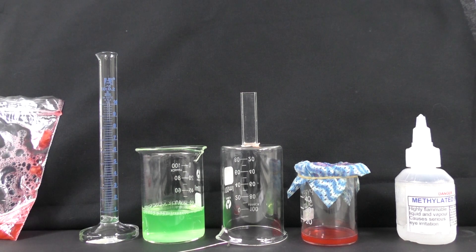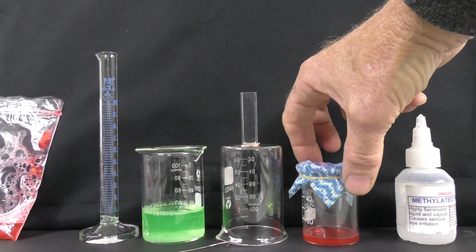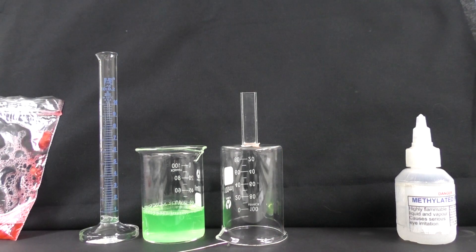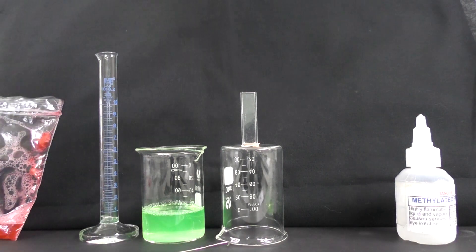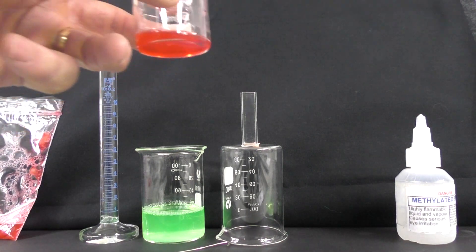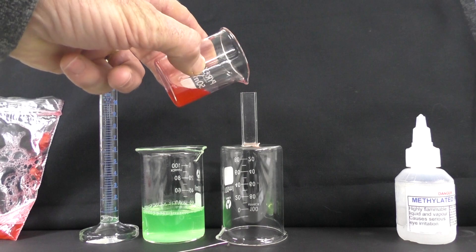Now because we're using a small vial we don't need a large volume of this. So I can take this top piece off now. And now we're going to pour this liquid into our little vial.